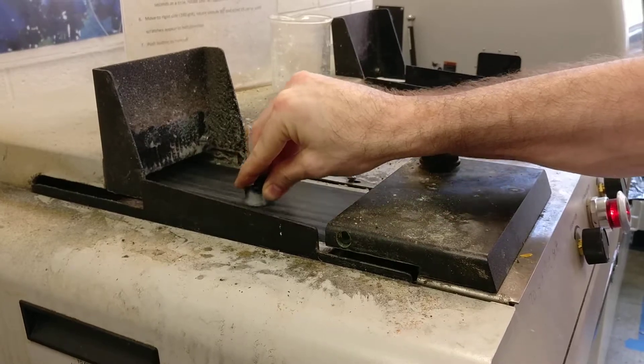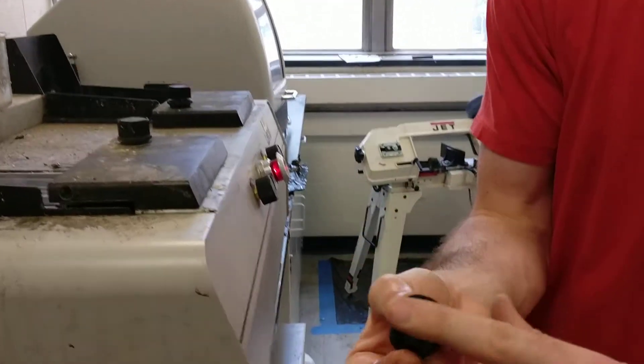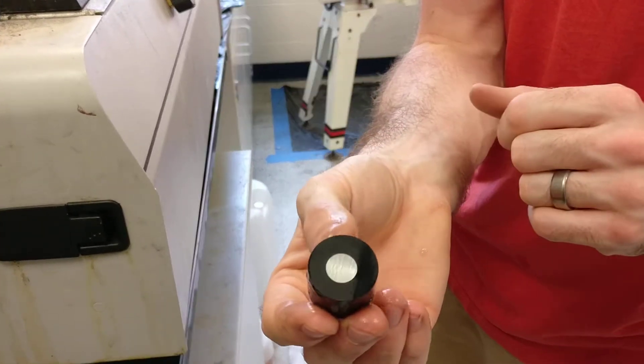All right, I feel like that's okay. You should feel a little bit of friction there. You can wipe it off with your fingers so you can see everything's uncovered.